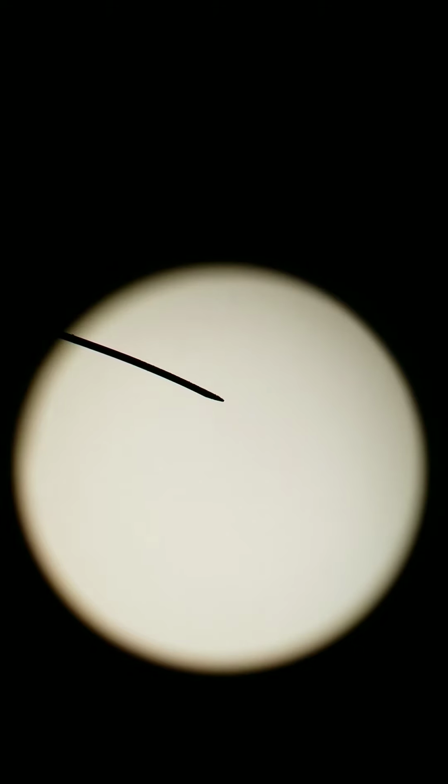It's not in focus yet, obviously, so I'm going to bring it into focus. It's already been centered. Here we are at scanning objective, 40x total magnification, and we can start to see a purple-ish blob in the center. That is actually a group of cells. It's not just one cell. I know it can get really confusing, especially with something like this, that it's just a small group of cells and there's not much else on the slide.